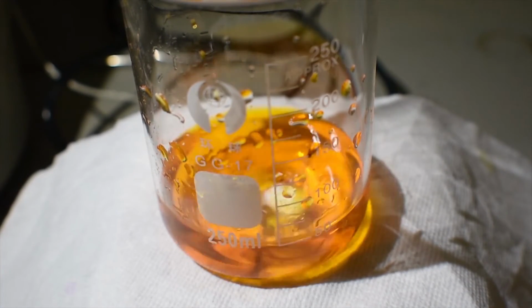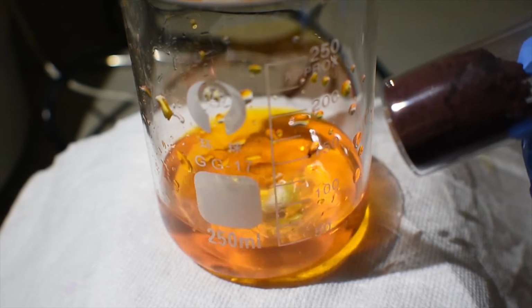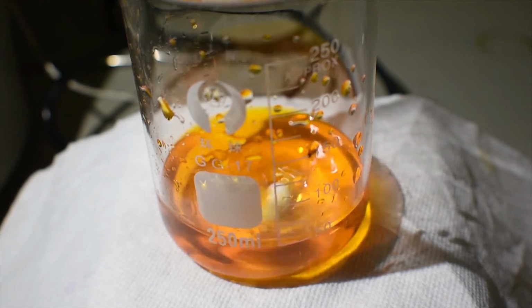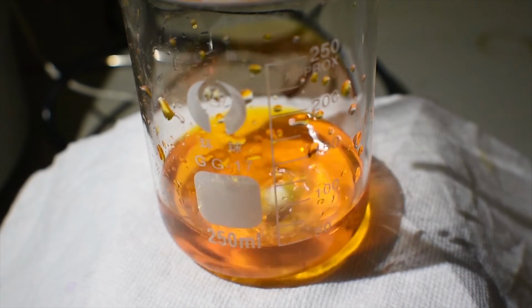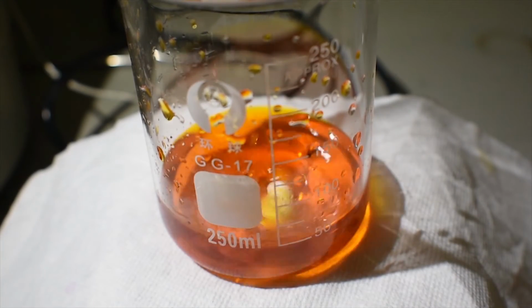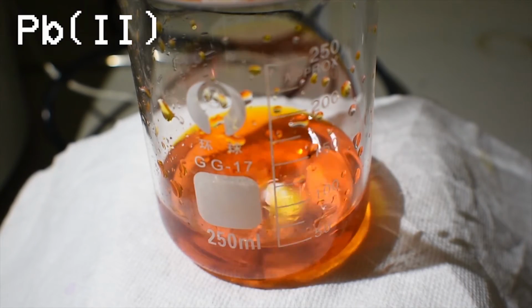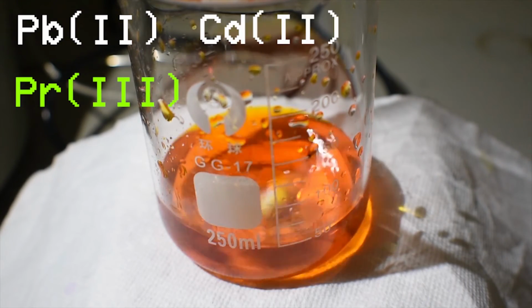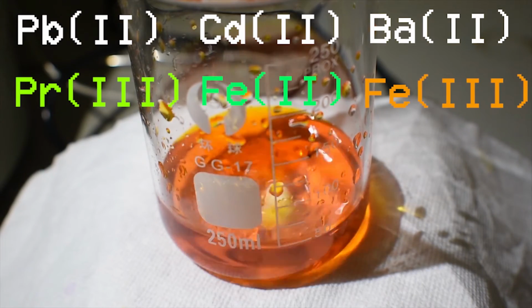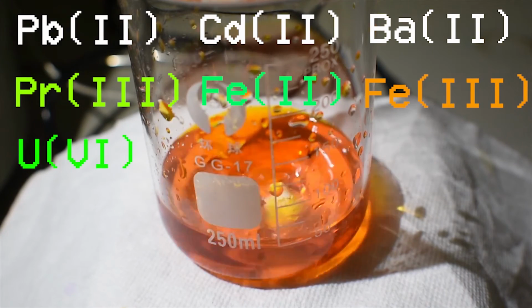Next, I'm going to dissolve some potassium rhodizonate, as you can see I have in this vial here, in some distilled water. Then I am going to add this to some solutions of heavy metal salts. These include lead 2, praseodymium 3, cadmium 2, barium 2, iron 2, iron 3, and uranium 6, and we will see what kind of color changes take place.